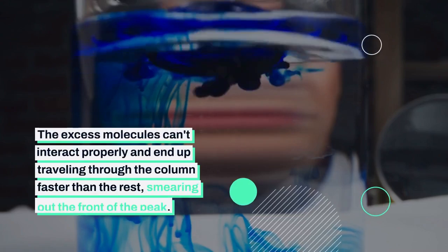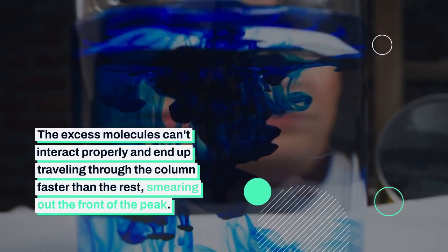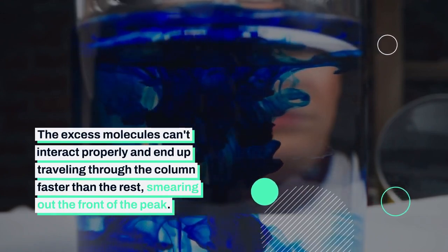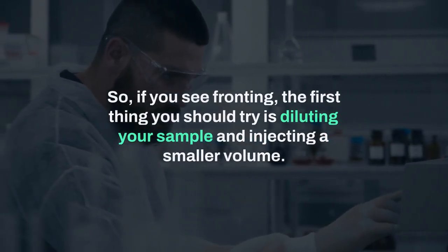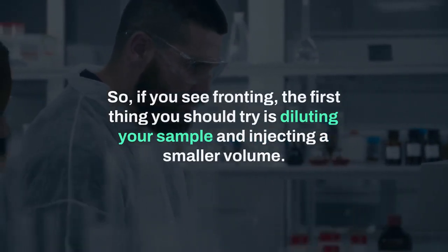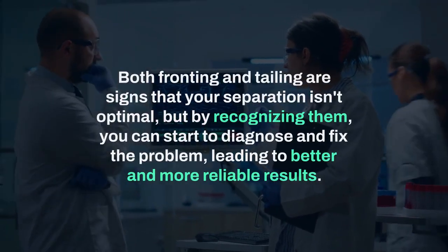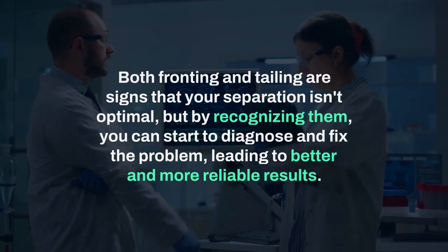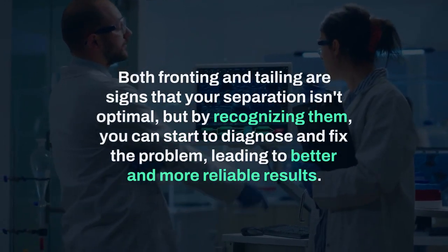The excess molecules can't interact properly and end up traveling through the column faster than the rest, smearing out the front of the peak. So, if you see fronting, the first thing you should try is diluting your sample and injecting a smaller volume. Both fronting and tailing are signs that your separation isn't optimal, but by recognizing them, you can start to diagnose and fix the problem, leading to better and more reliable results.